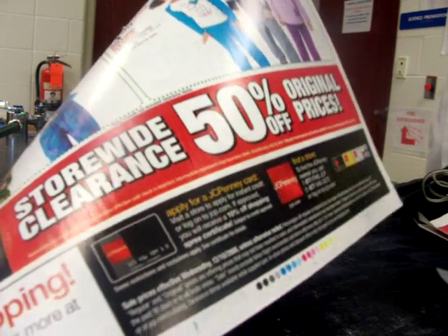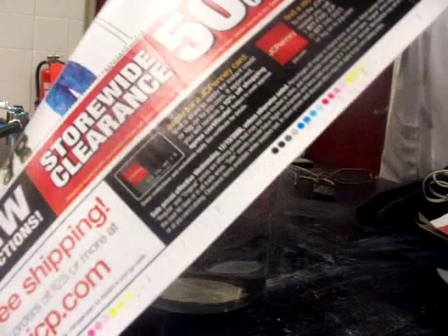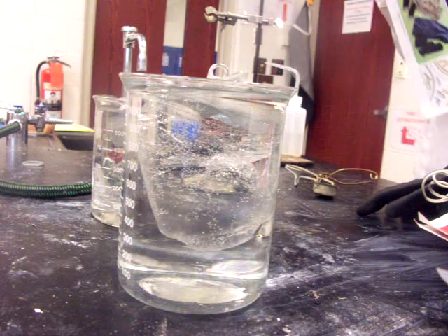So this here is what the pop cans look like after all of the aluminum has been dissolved away.